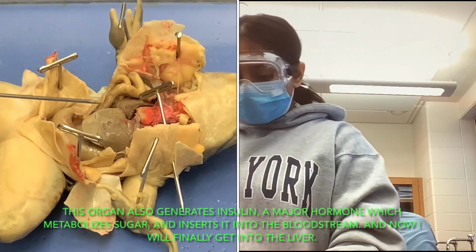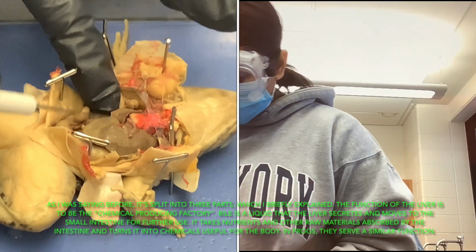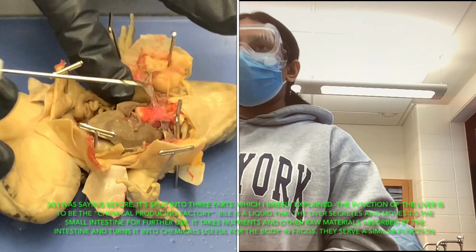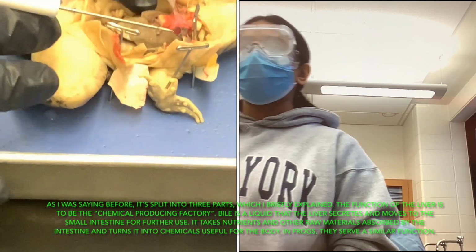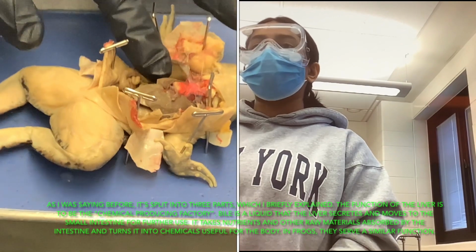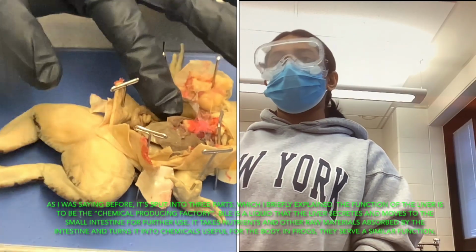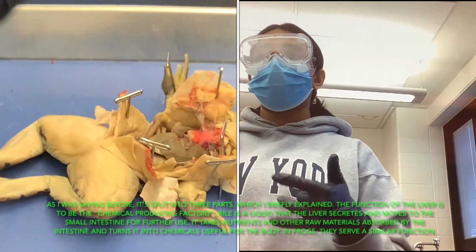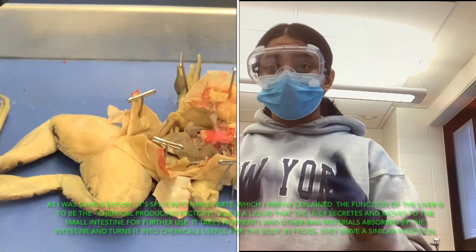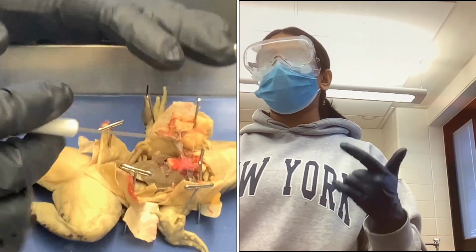And now I will finally get into the liver. It's split into three different parts, and I briefly explained those three different parts. Bile is a liquid that the liver secretes, and it moves to the small intestine for further use. The liver also takes nutrients and other raw materials absorbed by the intestine and turns them into chemicals that are useful for the body. In frogs, they serve a very similar function. They do the same things.